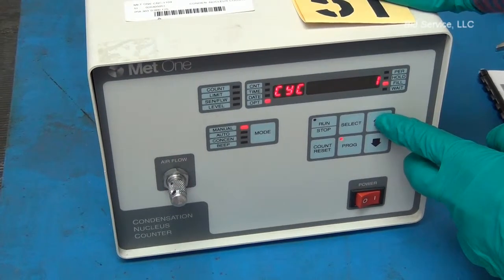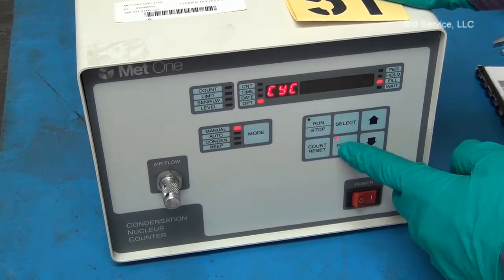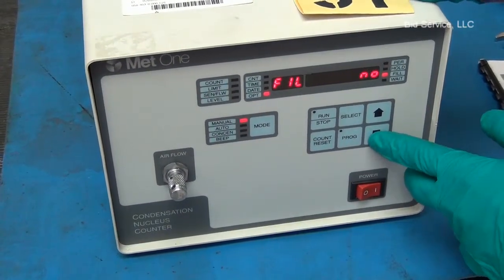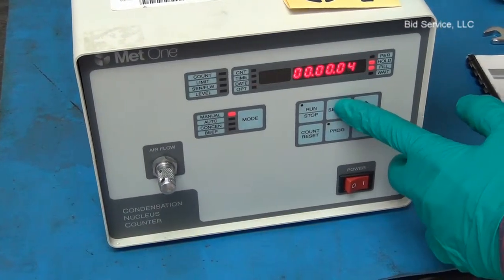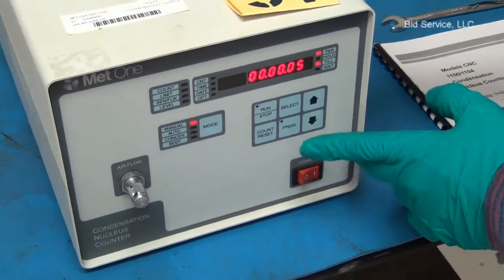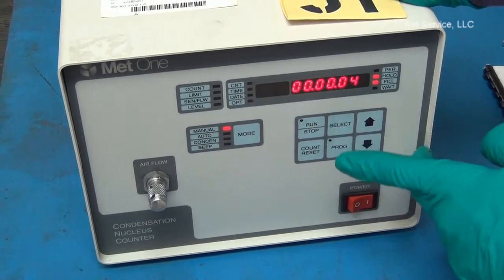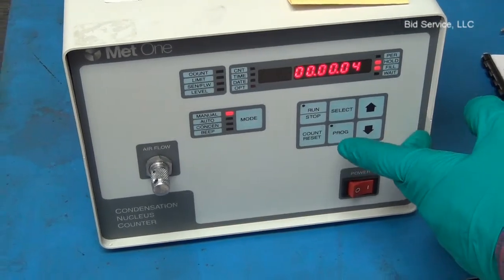In order to program it, you have to select the program mode and press on program again. Now the cycles are selected. This is the period — how many seconds or minutes you want the counter to count particles — and this is the hold period, 4 seconds between the periods of counting.